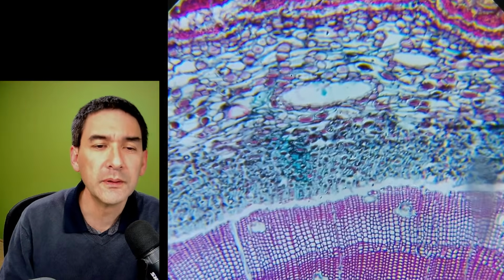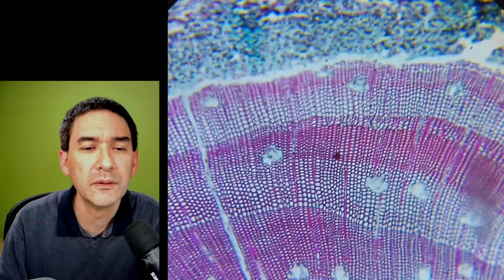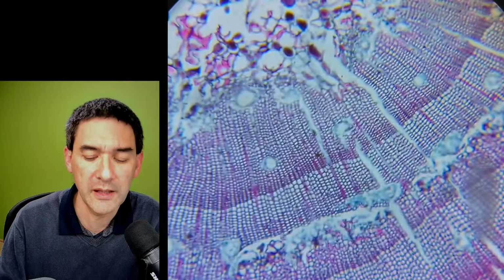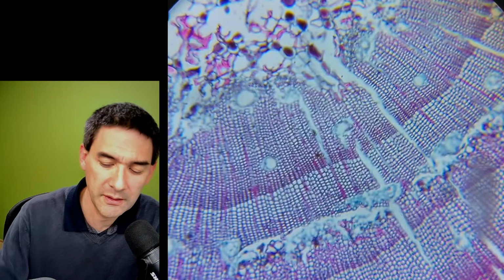I'm really gonna go random now because what is this here? Pine stem. Oh, stems, plant stems usually are quite nice. Yeah, here we go. Yeah, notice how the camera is always refocusing a little bit. Let's go up now with the magnification a little bit.